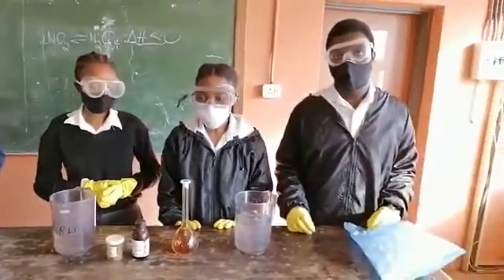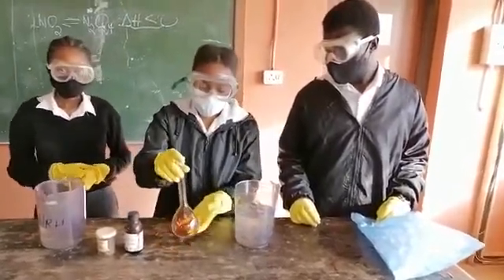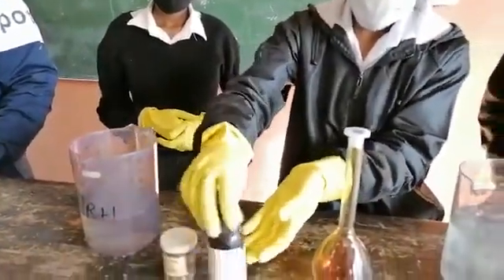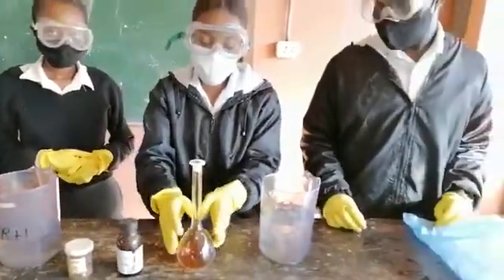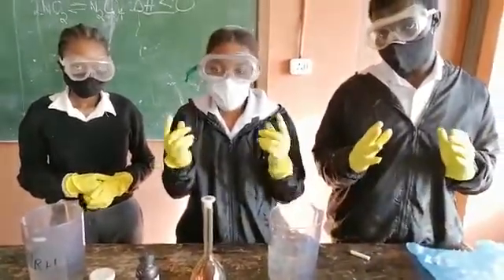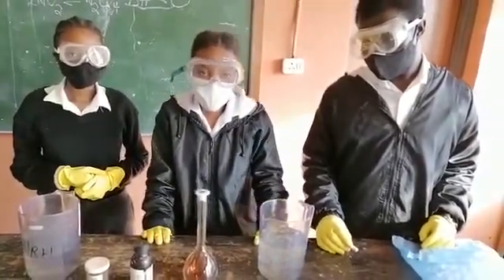Today we are going to be investigating the effects of temperature on equilibrium. We prepared nitrogen dioxide in this flask, and we used copper filings and nitric acid to prepare this gas. Before we prepared nitrogen dioxide, we ensured that we take precautionary measures into place by wearing our gloves, our safety goggles, and our masks, because nitrogen dioxide is a very irritating gas.